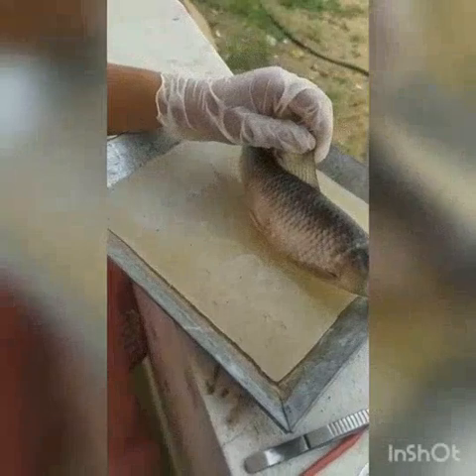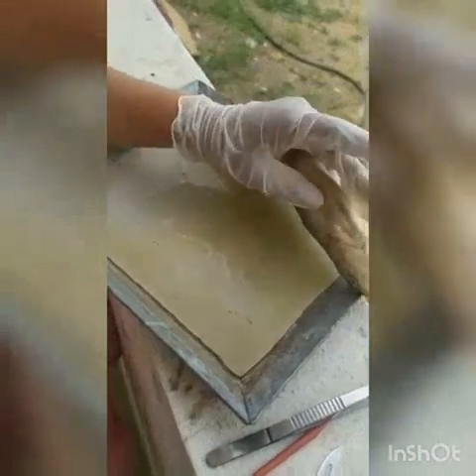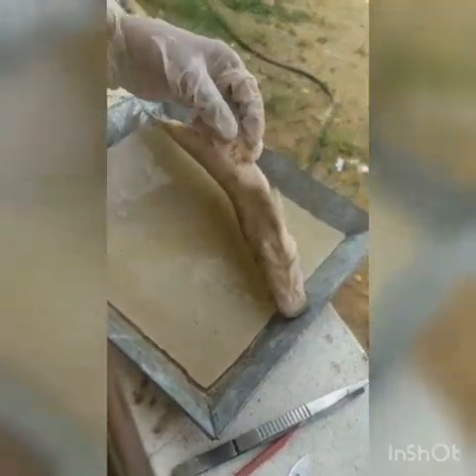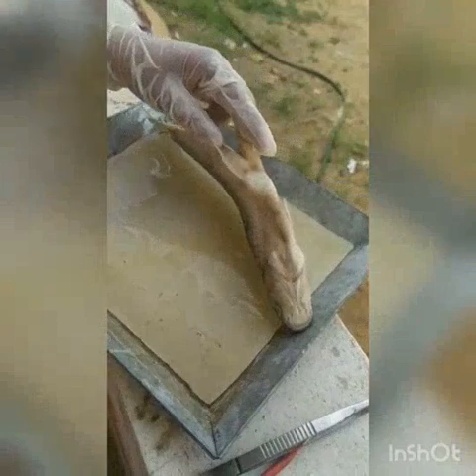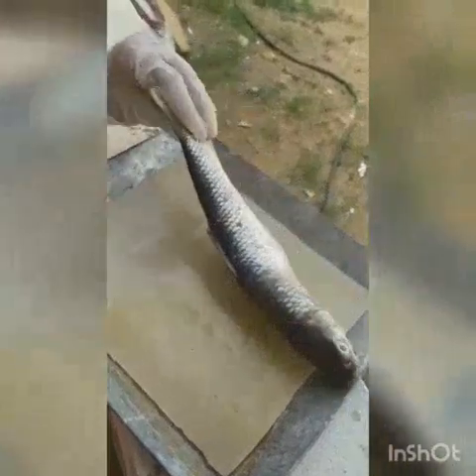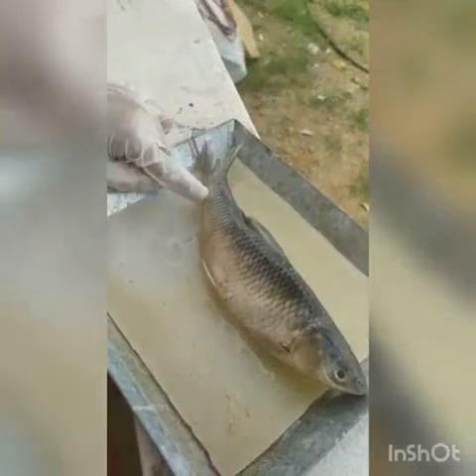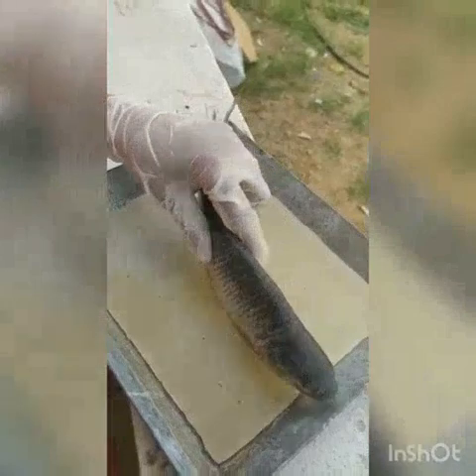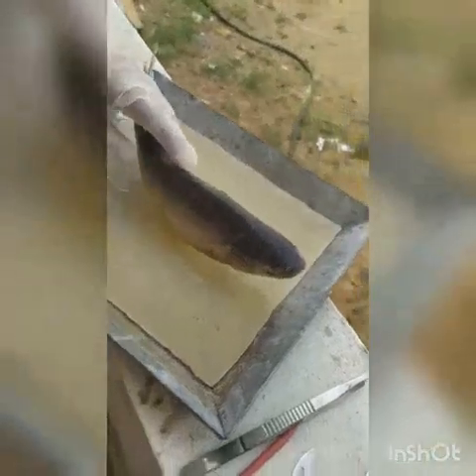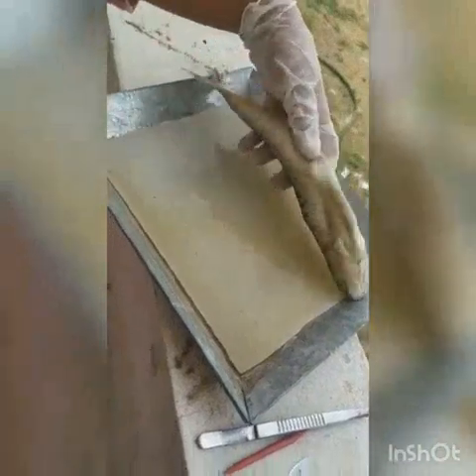Here you have a pair of pectoral fins, a pair of pelvic fins, a single anal fin, and these are the caudal fins. If you see clearly here, you find a dotted line structure which we call the lateral line. The color of the body is grayish black towards the dorsal side, but gradually the body color lightens as we move to the ventral side, becoming a silvery whitish color.